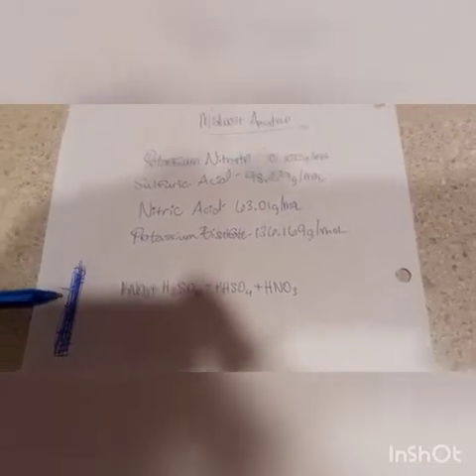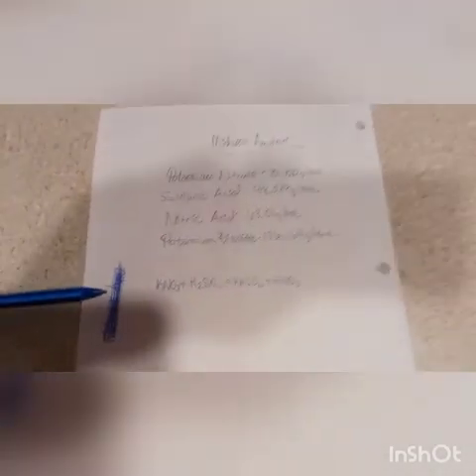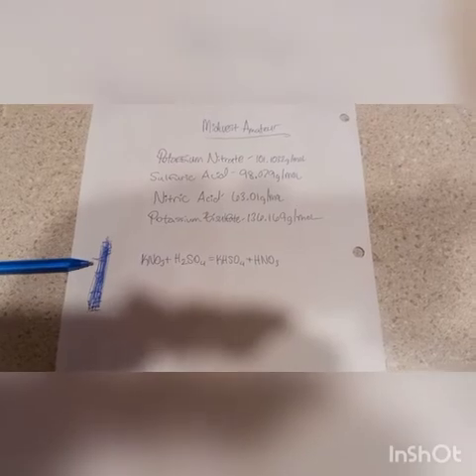So my yield was actually fairly good. I got a lot out of it, and I was happy about it. It is contaminated, so I can't really get a good concentration on it.